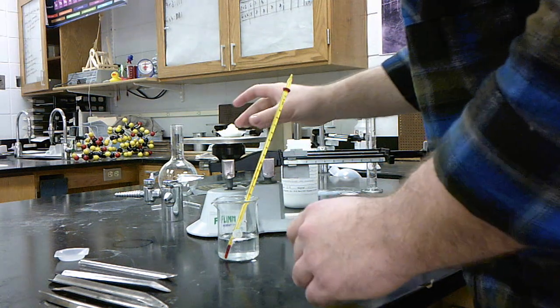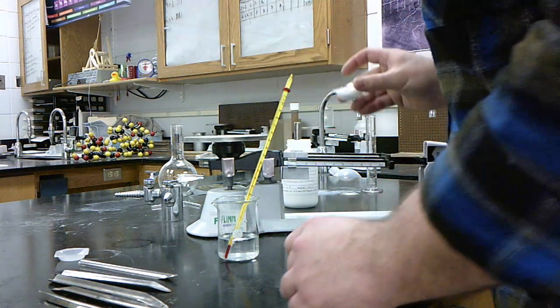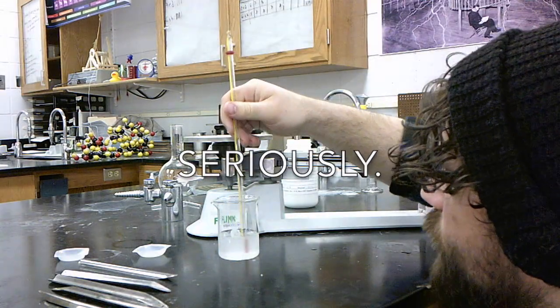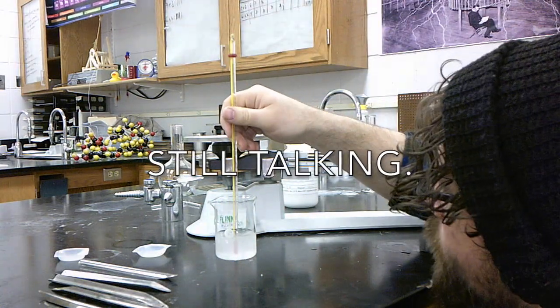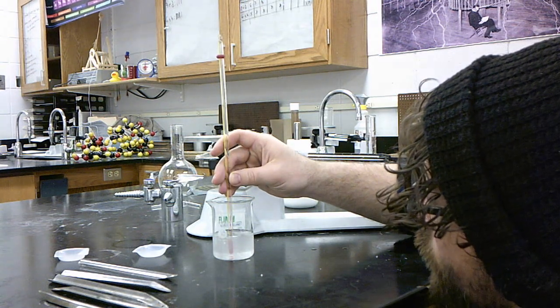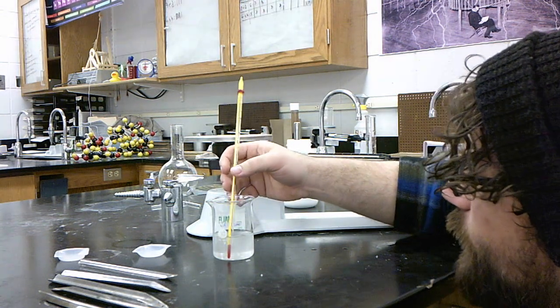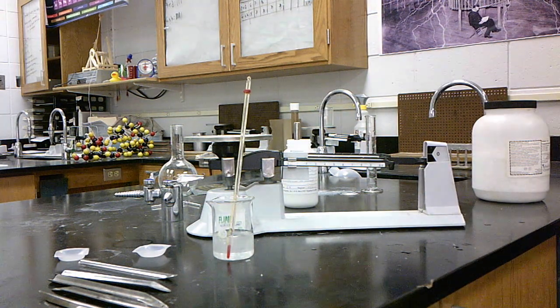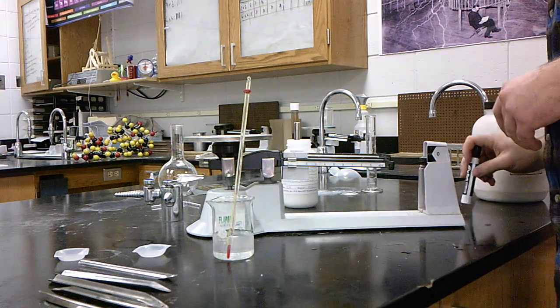And now I add my ammonium nitrate. Right around 12, okay. So we've got 12 degrees as our final temperature. So we lost 10 degrees Celsius. 10 whole degrees. It's not bad. Okay.